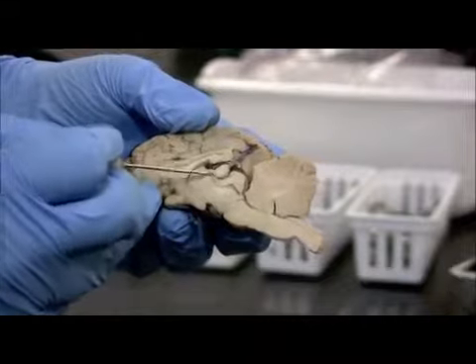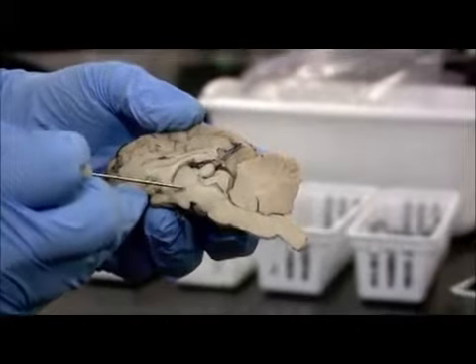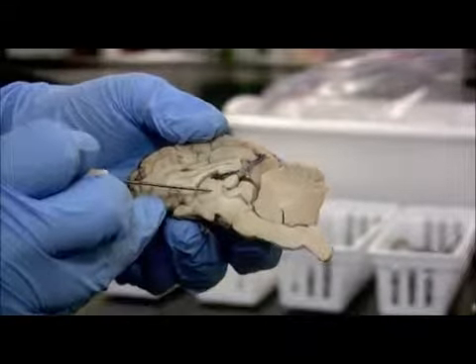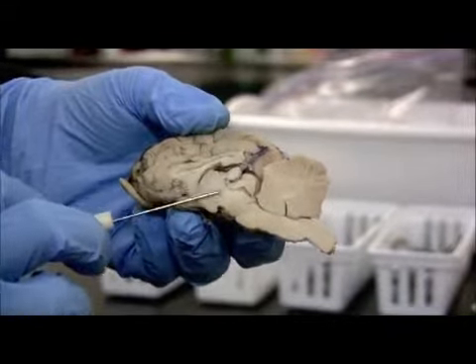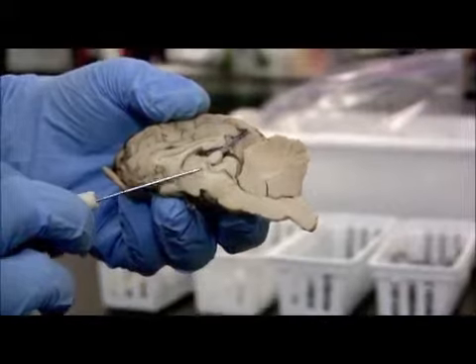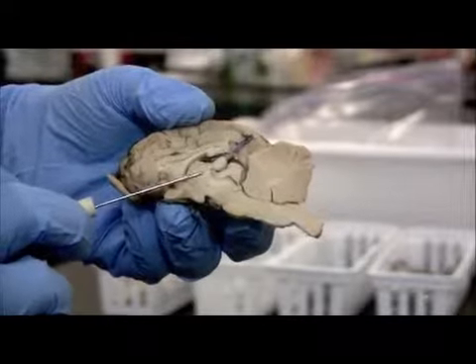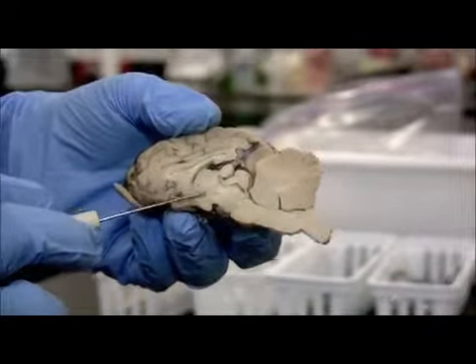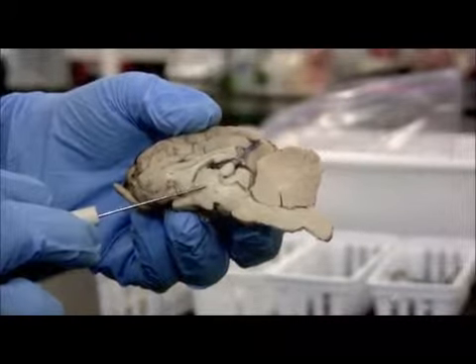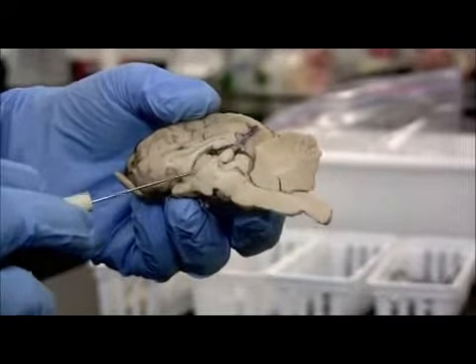Down below, we have this really well-formed circle. It's a very circular bit of tissue, and that is the thalamus. Remember, there are 2 sides, a left and a right side. So if we cut straight down the center, this is where the 2 thalami meet. So the interthalamic adhesion is that part we talked about that's missing in 30% of males, the connection between the 2 sides of the thalami. But it's a very good landmark when you're looking at a sheep brain that doesn't have a lot of differences in the tissue. It just looks like a big blob of tan tissue. So if you have the circle, that's the thalamus.